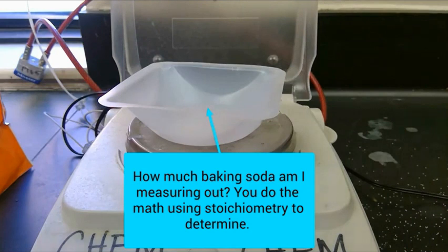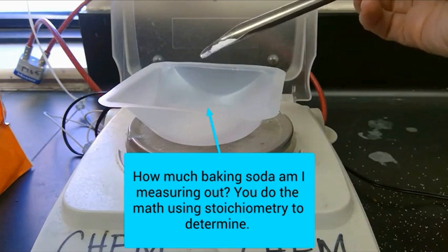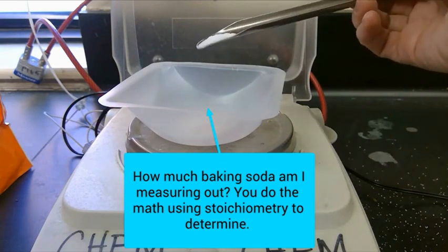Purposely I'm obscuring what the scale says because your job in this lab is to determine how much baking soda you need to react. So we're not going to tell you the number that we're measuring into that right now. But that measurement you'd get from your stoichiometry.